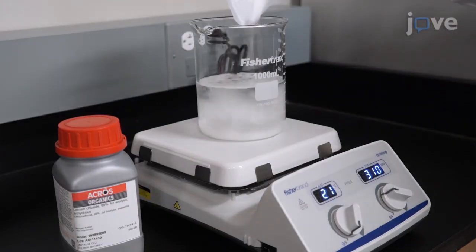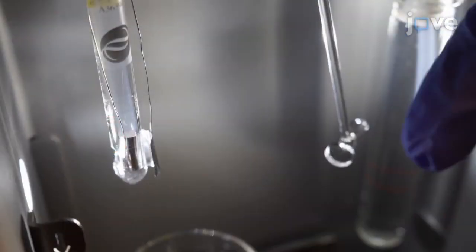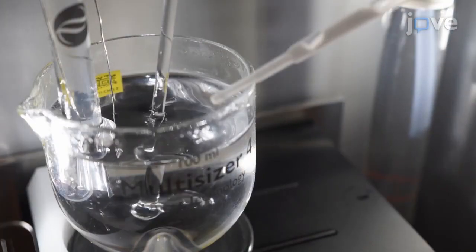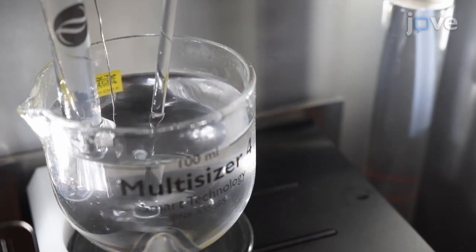This technique enables a reproducible and statistically valid determination of starch granule sizes and provides a proper description of statistically distributed granule sizes. This technique determines starch granule volumes independent of their shapes and uses statistically valid granule sample sizes for size distribution and provides an improved specification of granule size distributions.